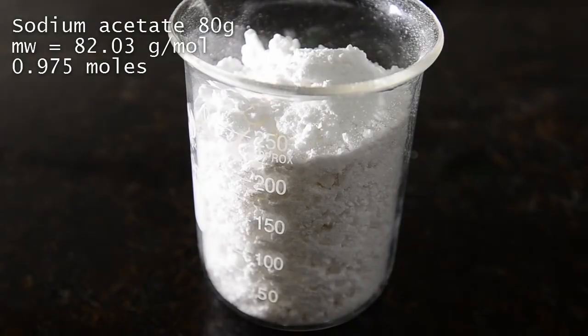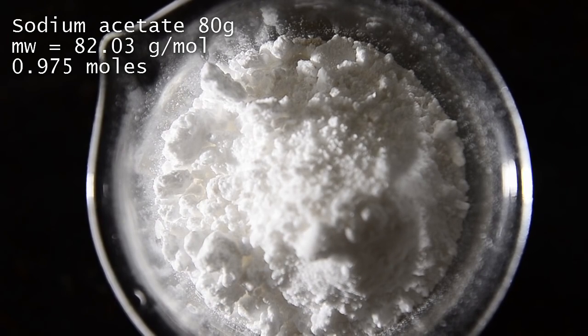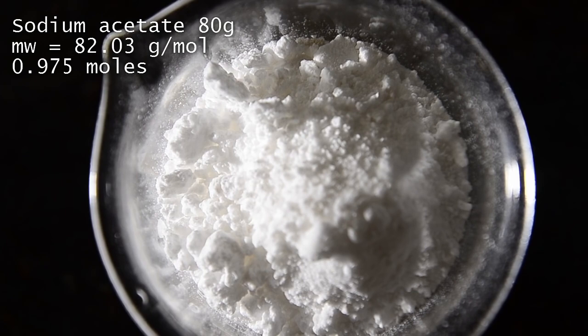We've baked ours in an oven at 200 degrees C for 4 hours in total, occasionally stirring the powder. The textbook process is to actually melt the solid prior to performing the reaction, however we wanted to see if we could get a reasonable yield through just oven drying.